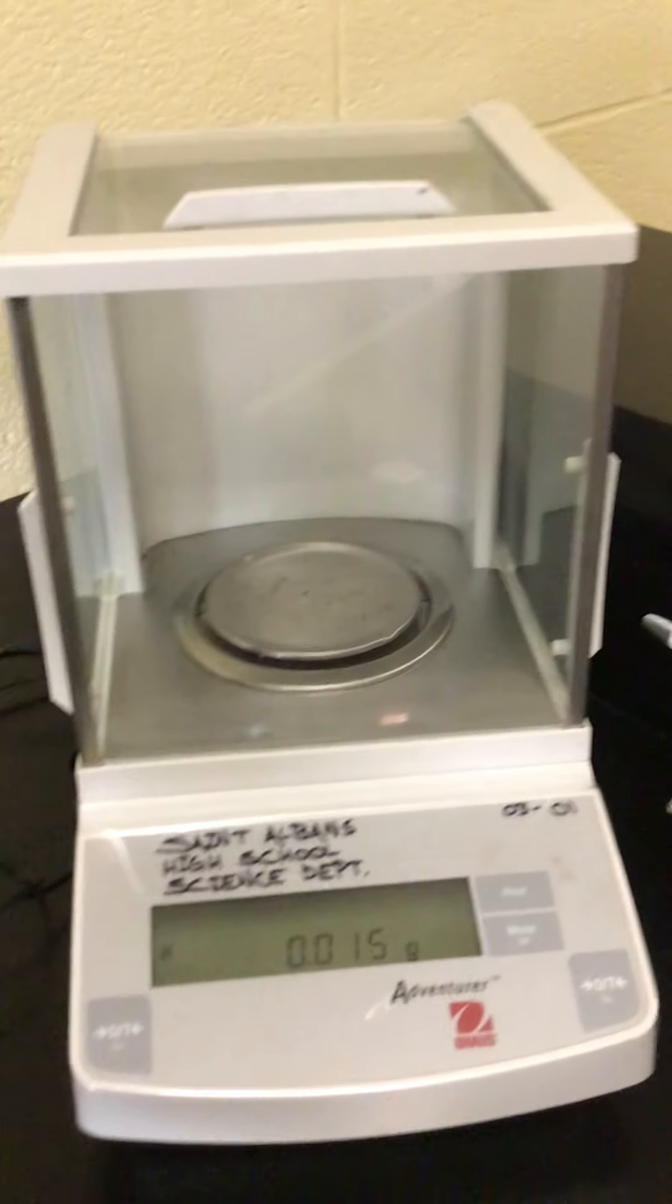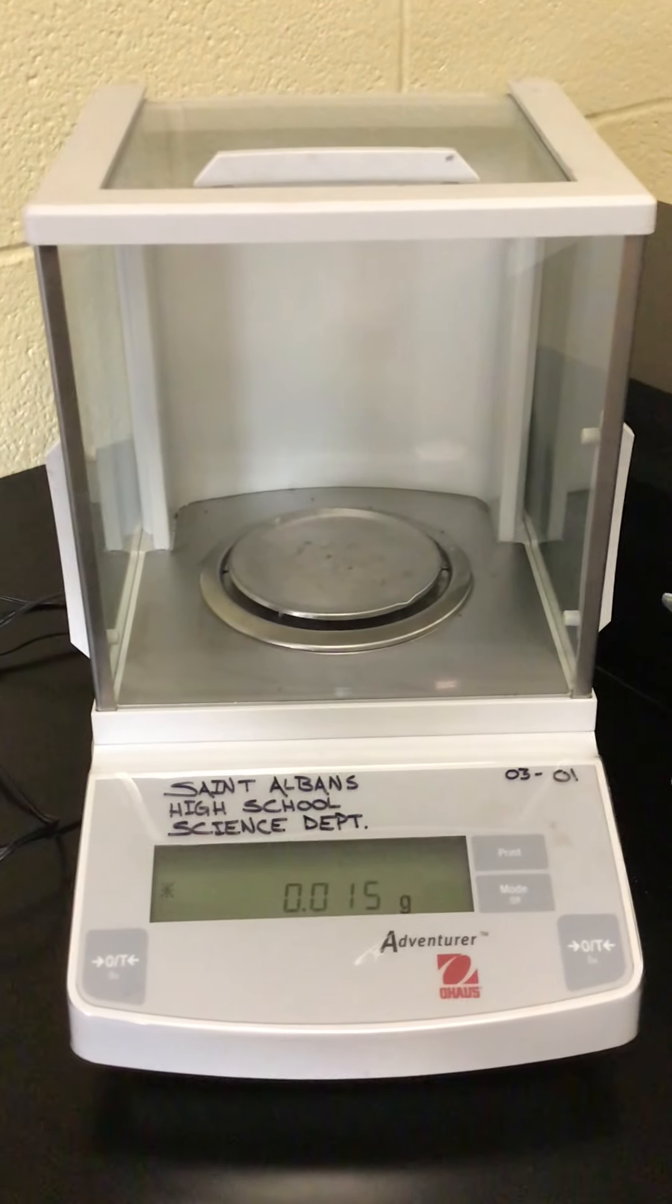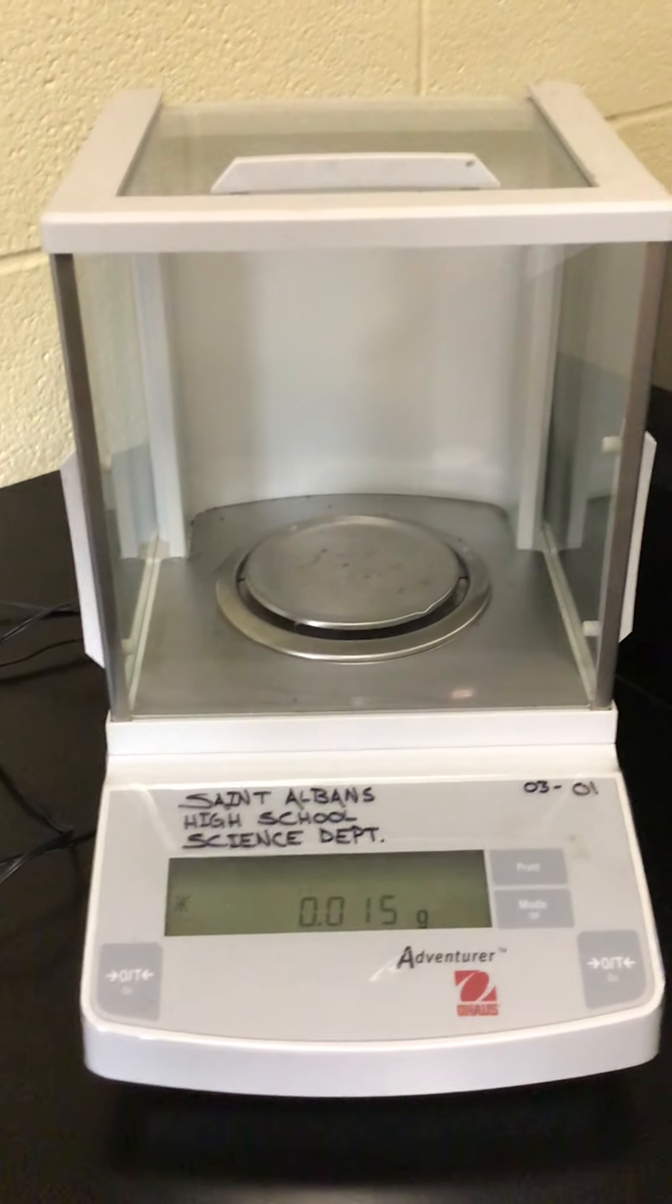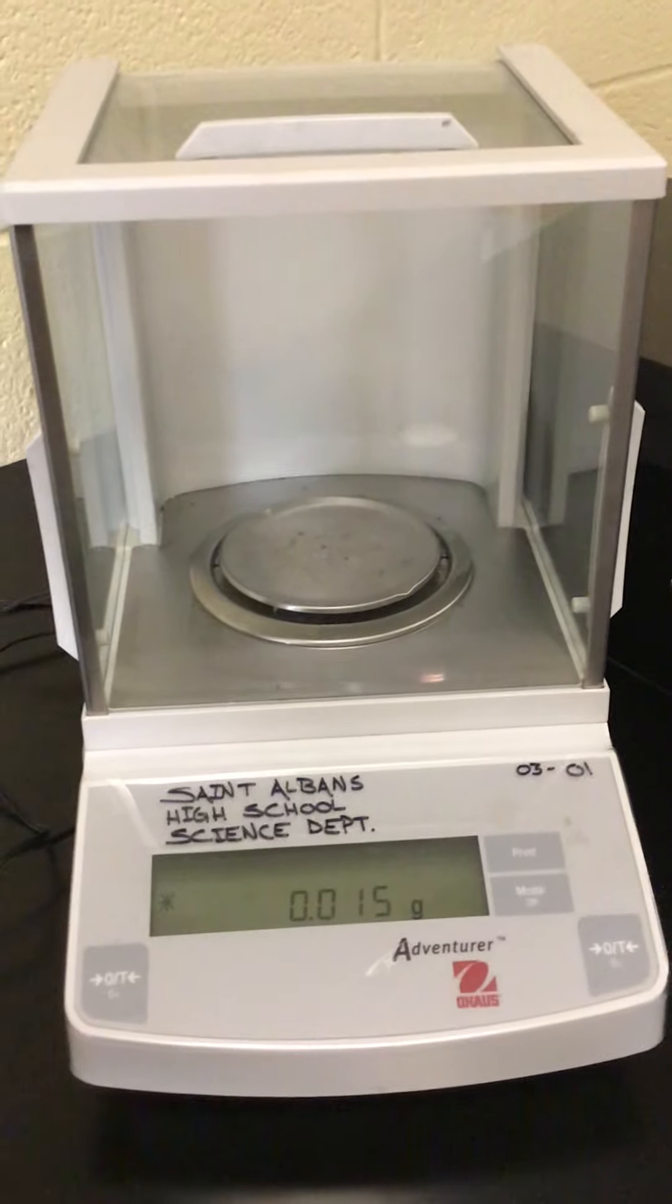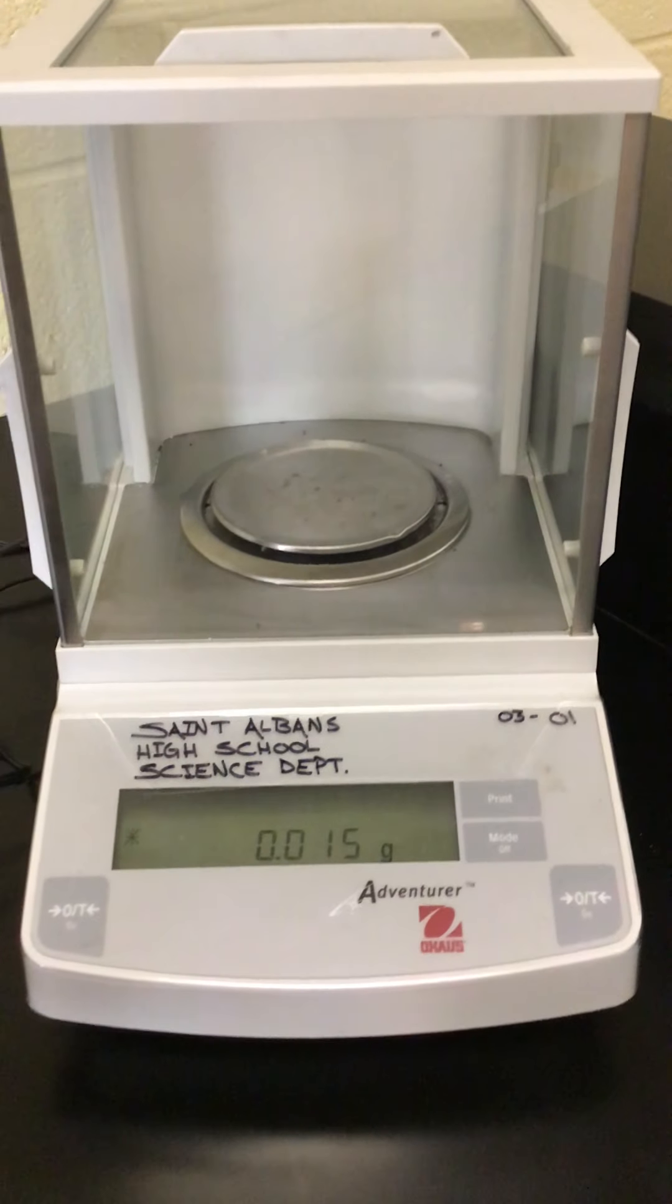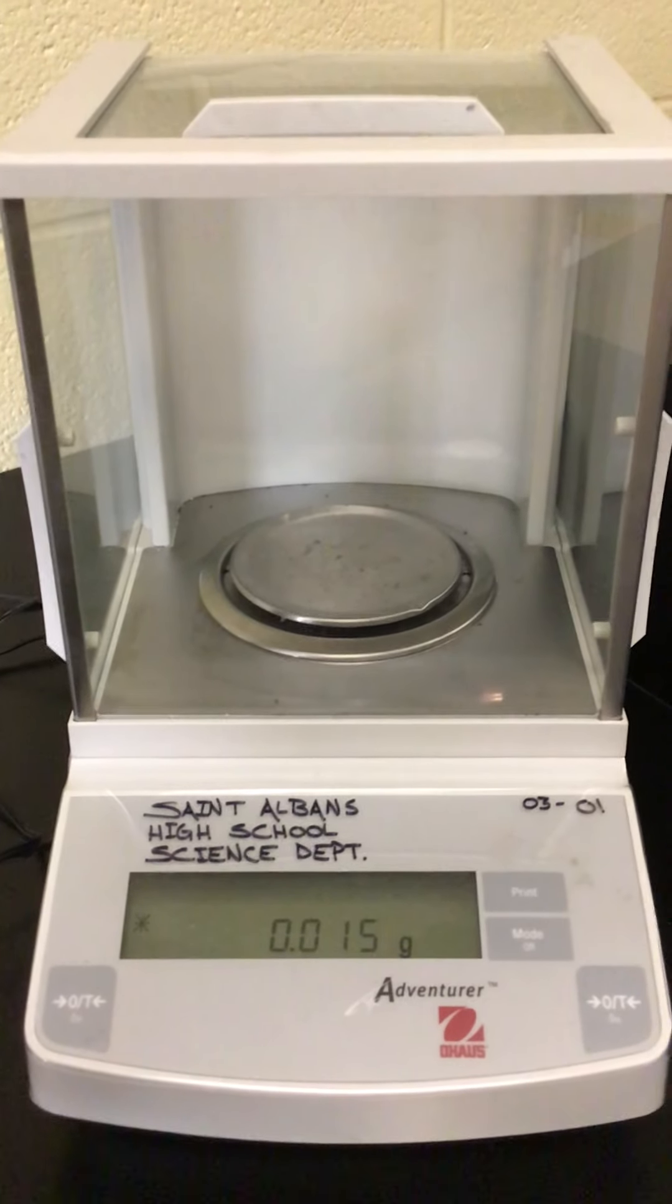So what we want to do is we want to zero it out so that it's reading zero things on the scale as zero grams. And no matter how good your scale is, it'll likely always need to be calibrated in this way before you use it.